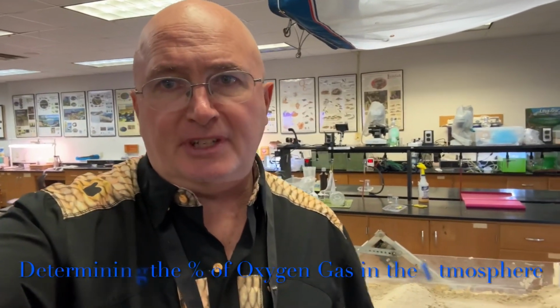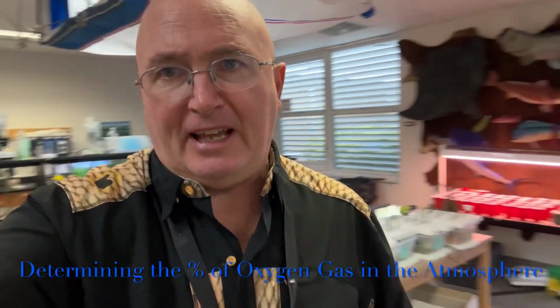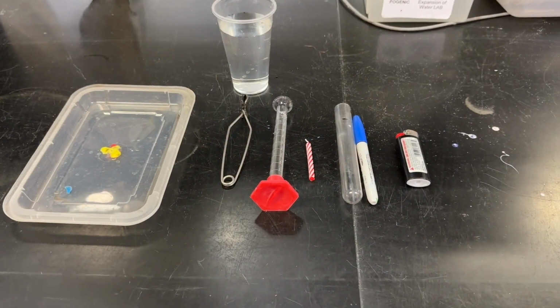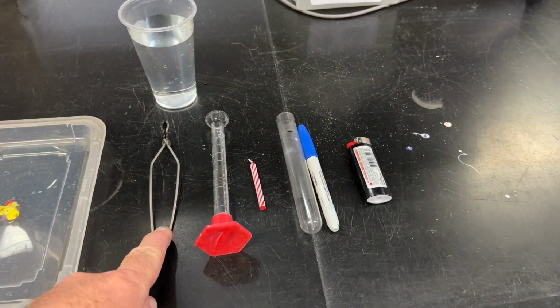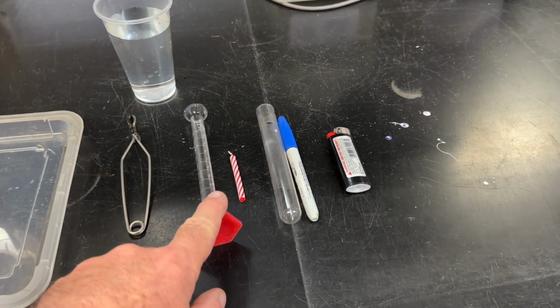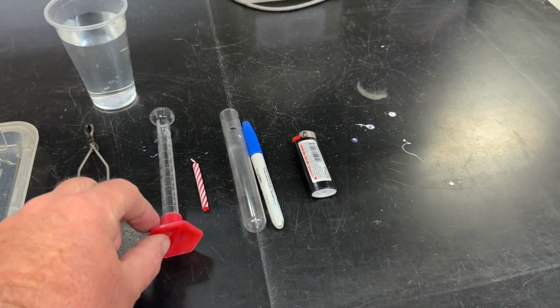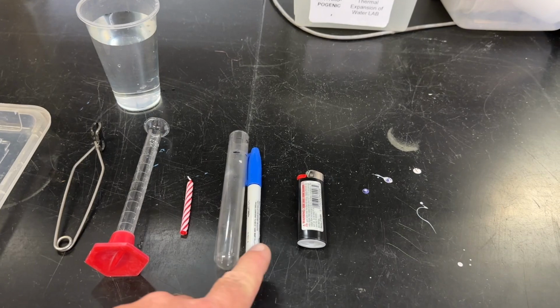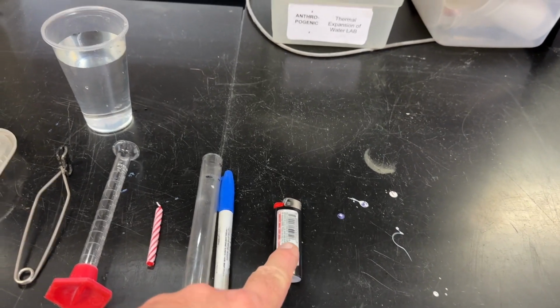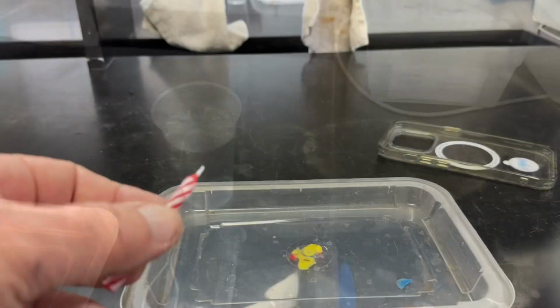Today's lab is determining the percentage of oxygen in the atmosphere. So for this lab, let me start by showing you the materials. For the lab, you're going to need a shallow dish, a test tube holder, a 10 milliliter graduated cylinder. Notice it's laying on its side when not being used. A candle, test tube, Sharpie, lighter, and some water.